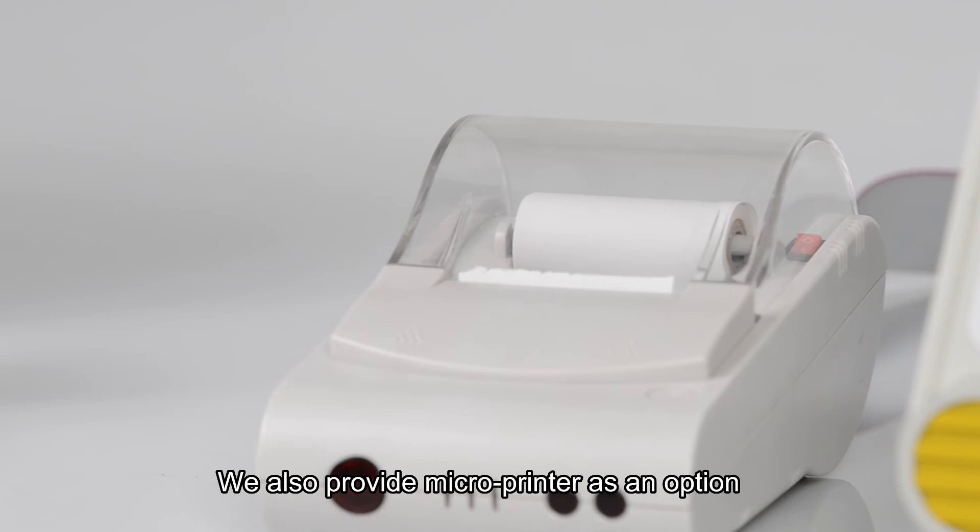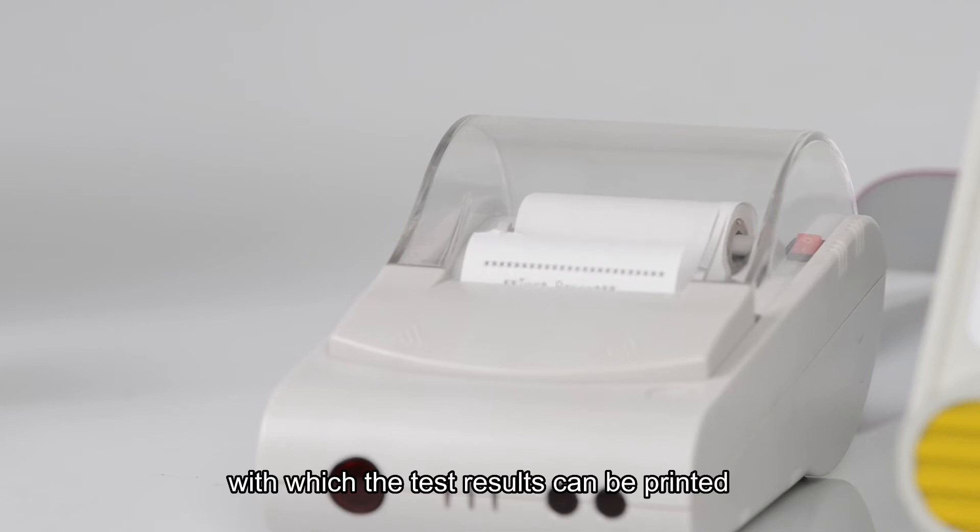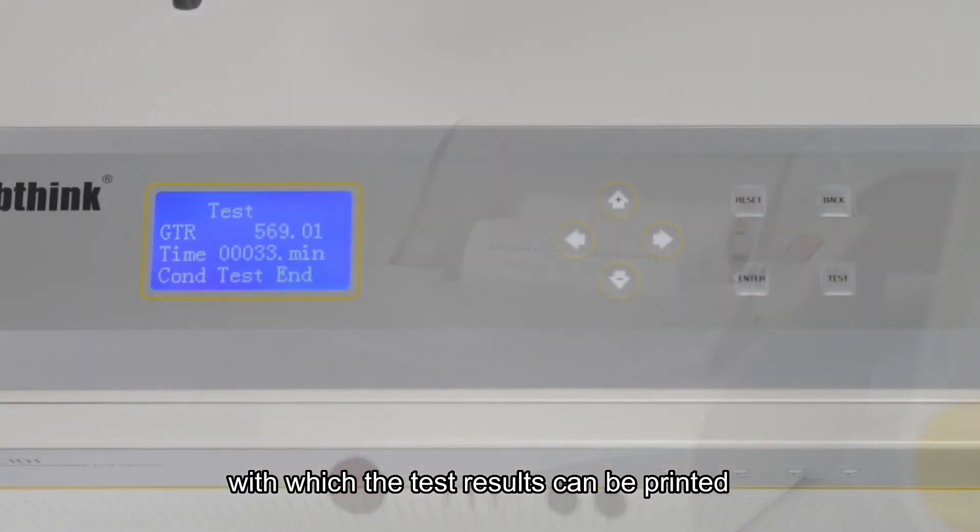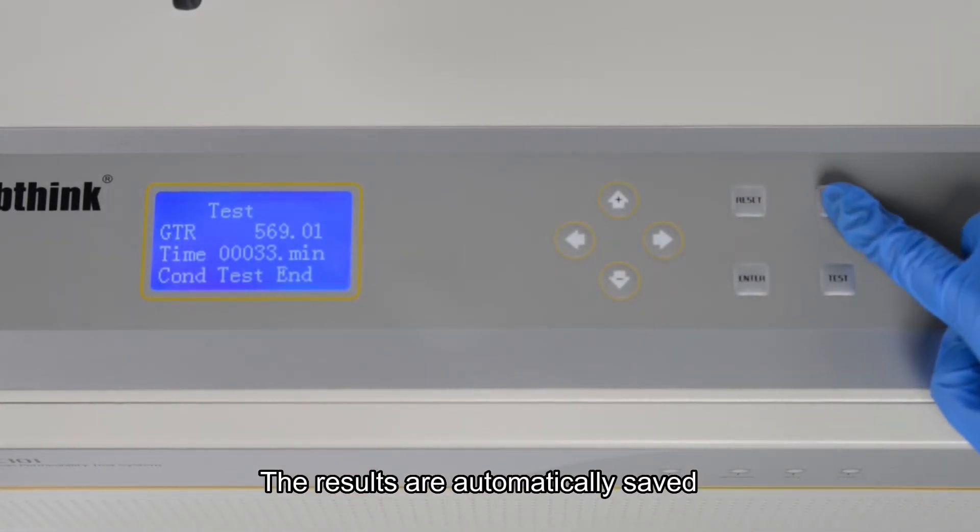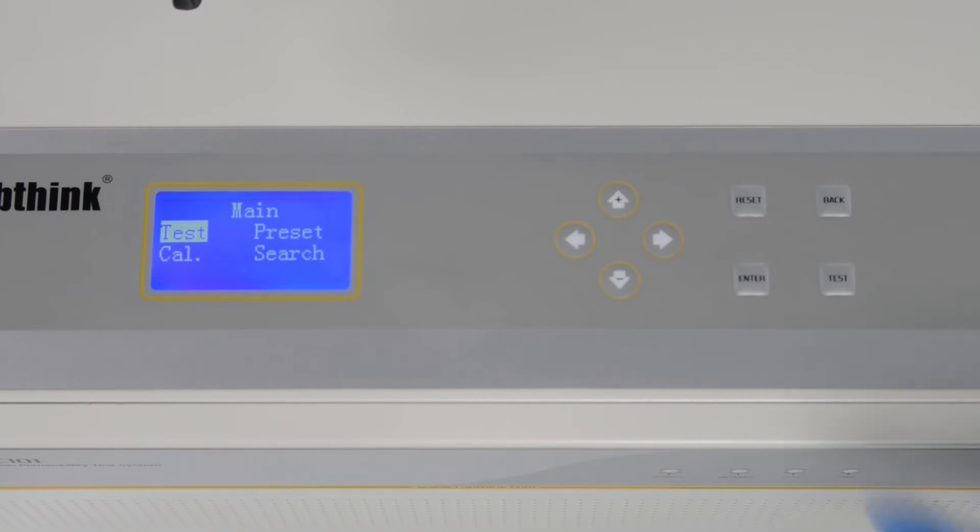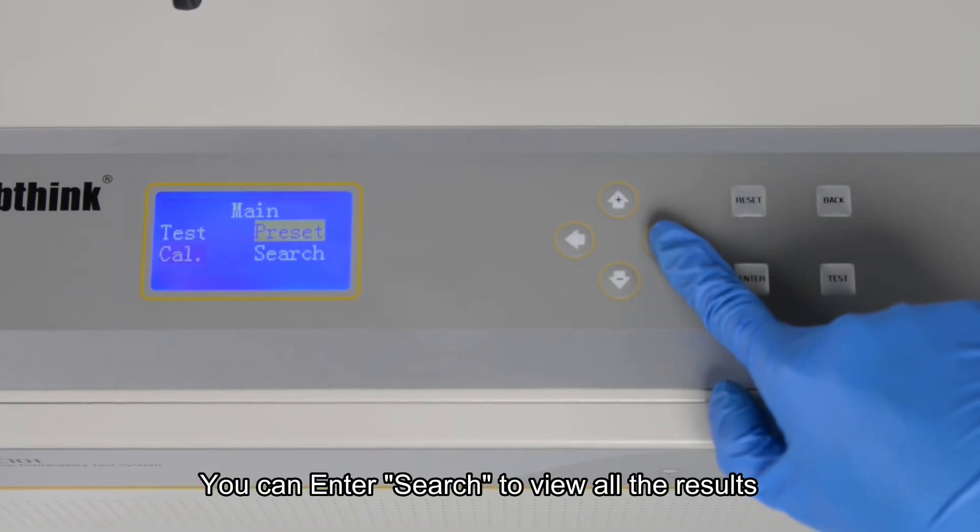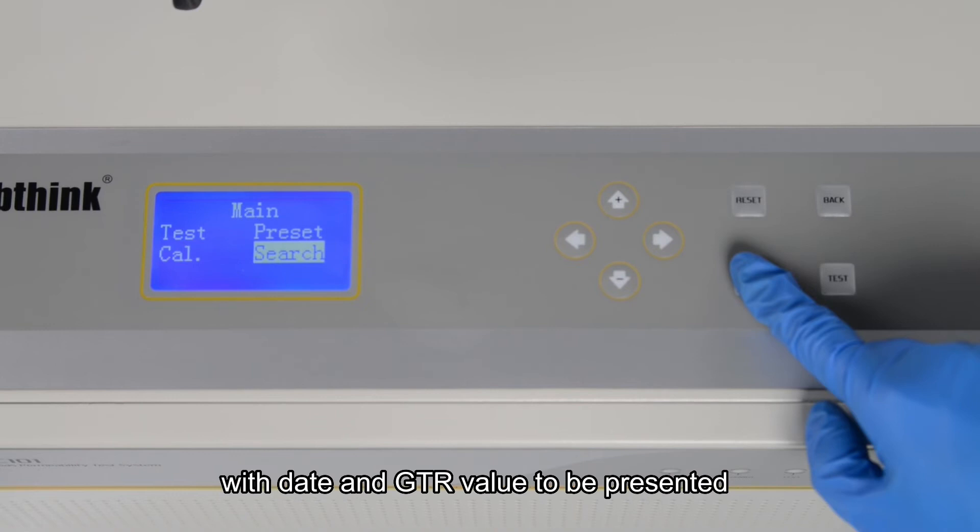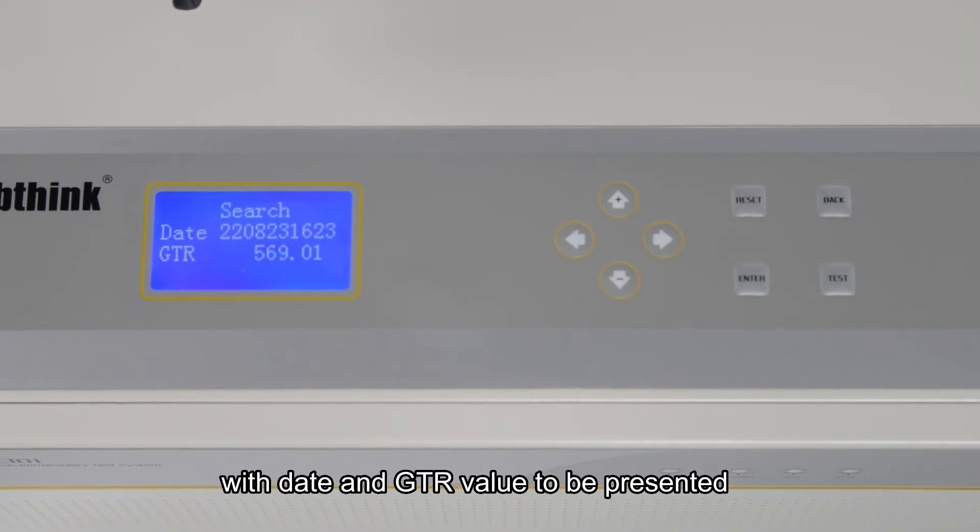We also provide micro printer as an option, with which the test results can be printed. The results are automatically saved. You can enter search to view all the results, with the date and GTR value to be presented.